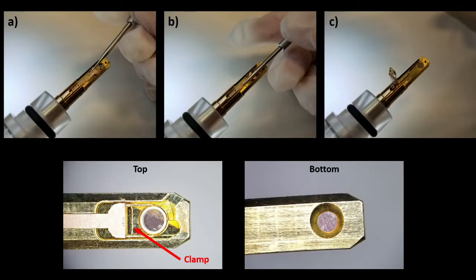The first thing you will learn is how to prepare the TEM grid into the single tilt holder. There are various holders available, but the single tilt is one you will use very often. The clamp is very delicate and has a specialized tool to open and close it. Be sure not to damage or lose this tool.